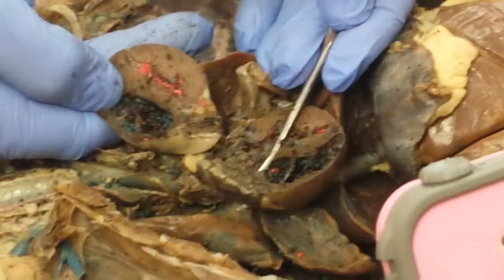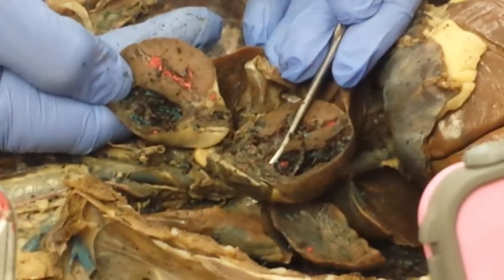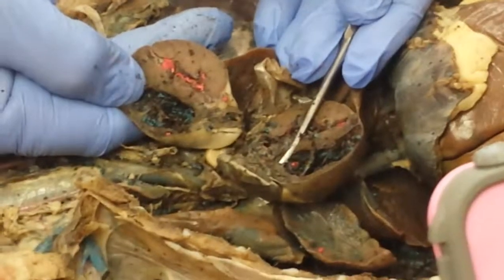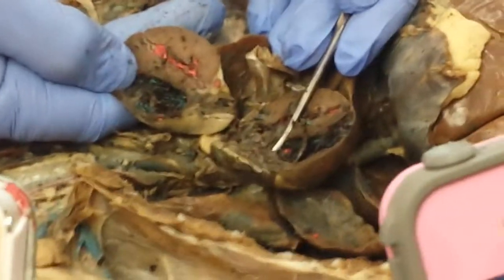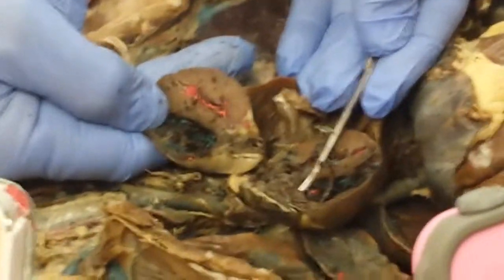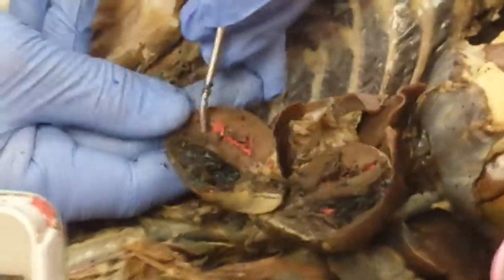The main thing for your lab practical when I'm testing you is to know the location. So if you know where the right ventricle and the right atrium come together, then you will be able to tell me where the tricuspid valve is at. What are these little fibrous structures here that hold the papillary muscles? No, the fibrous structures. Chordae. Chordae, see that? But you're correct.